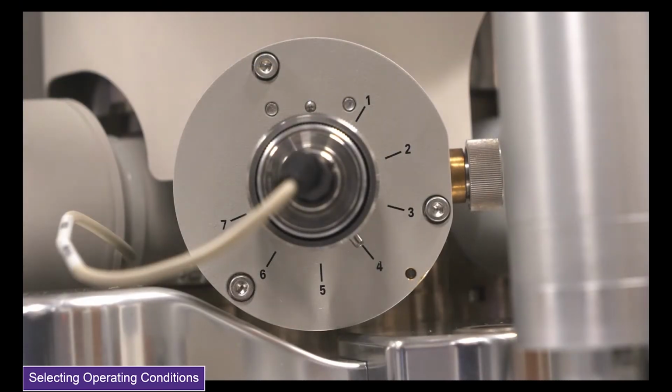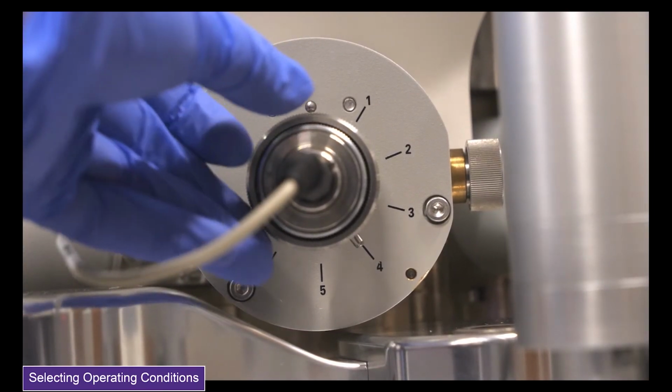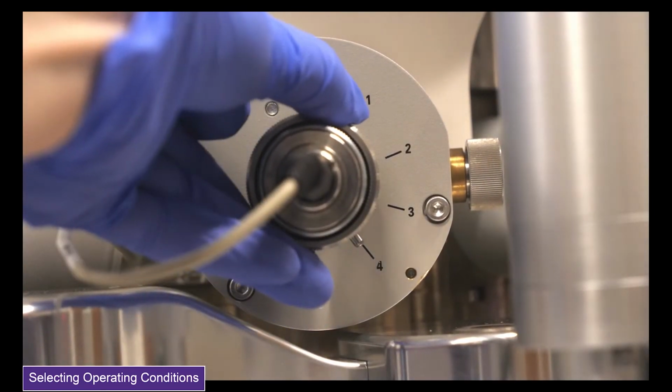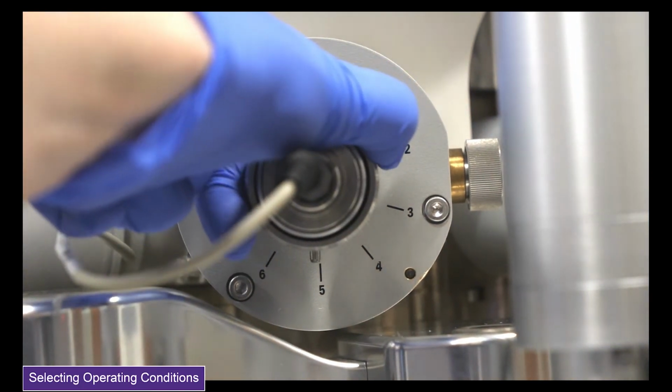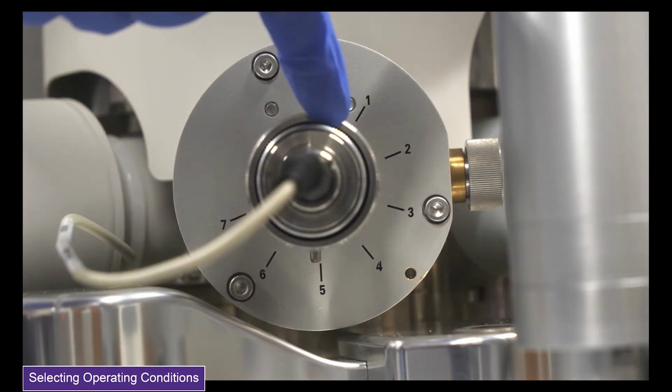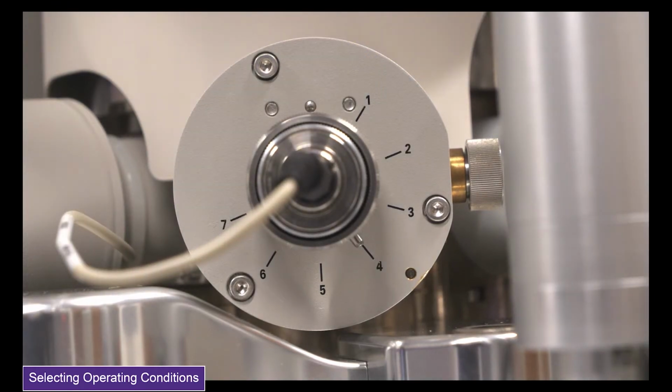Next, you will need to set your objective aperture. You can change your objective aperture by turning the knob on the microscope column. Turn the knob until it's pointing towards the objective aperture size that you'd like to use. Smaller apertures, between 5 and 7, are generally used for imaging, whereas larger apertures, 1 to 4, are used for maximizing probe current for analytical techniques.